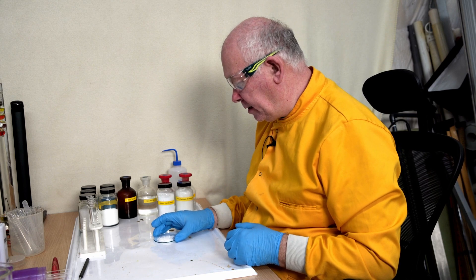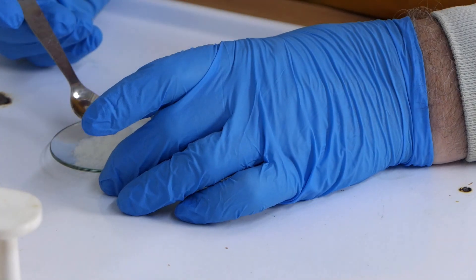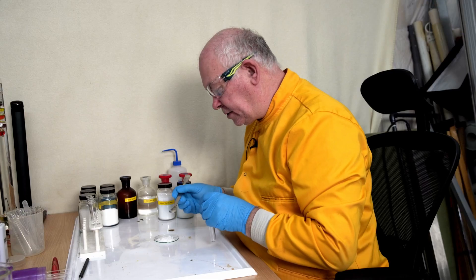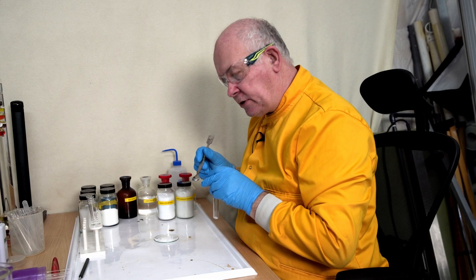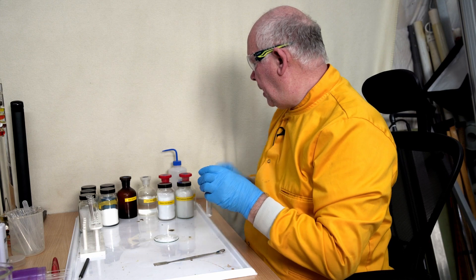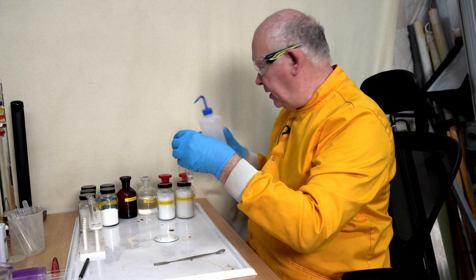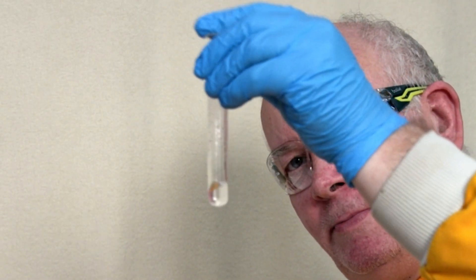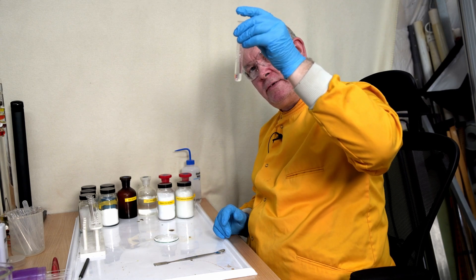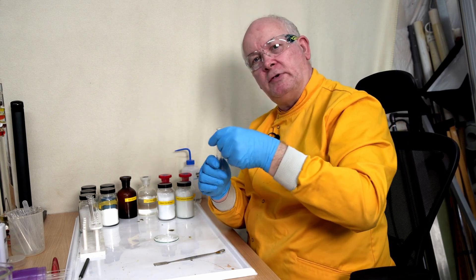So our first thing is to take a little bit of this substance — I really don't want very much, so I've literally got just a few crystals of this. I'm going to put this in a test tube and we're going to add some distilled water. I've made up about one centimetre depth, because we're only performing a little test. So I've now got my sample, which is strontium something.